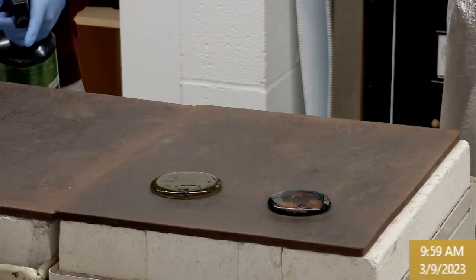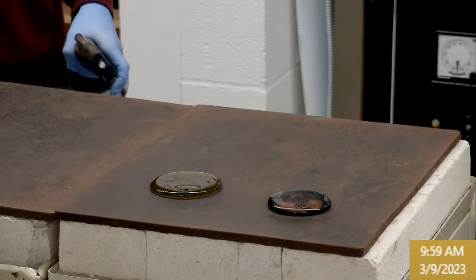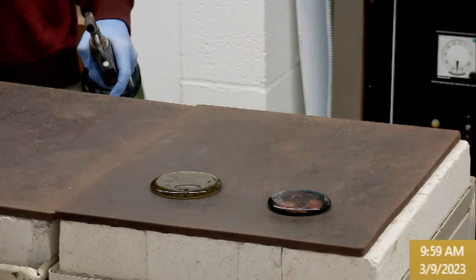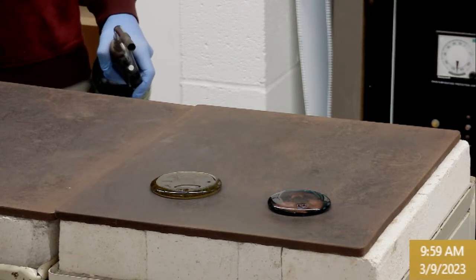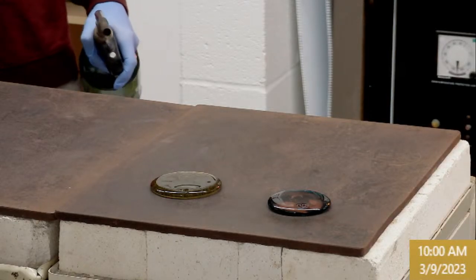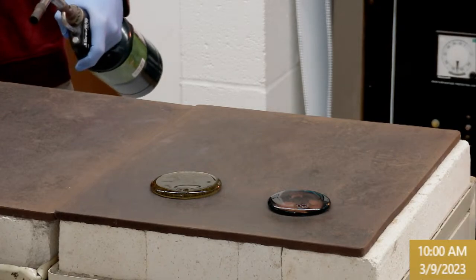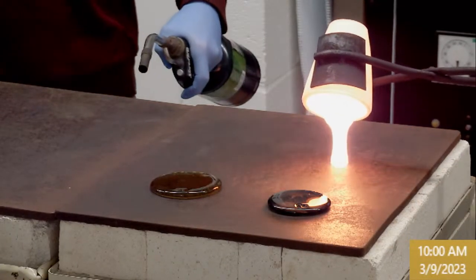It gets hard once this gets filled. So we don't have that many compositions today, so it won't be as bad. All right, so pulling from the middle, 3M. I think we're ready. Oh, there we go.